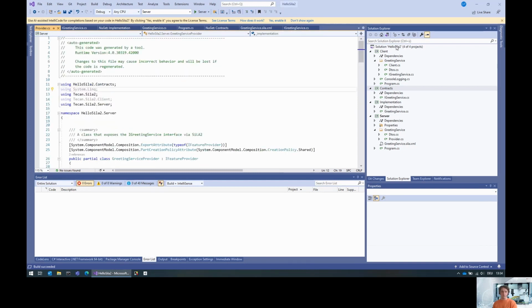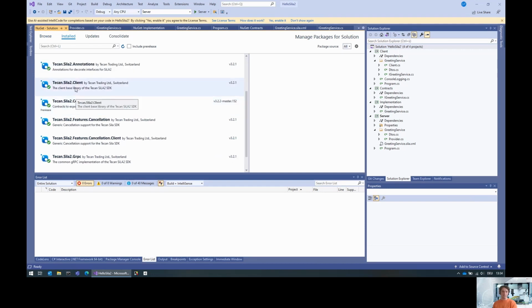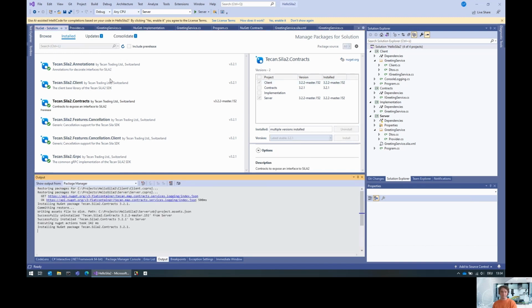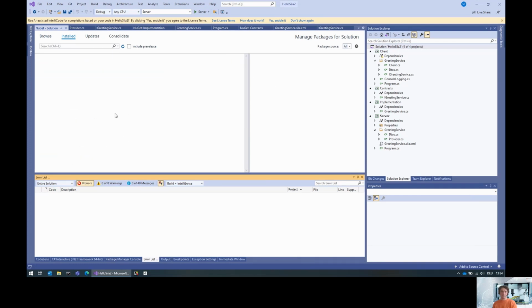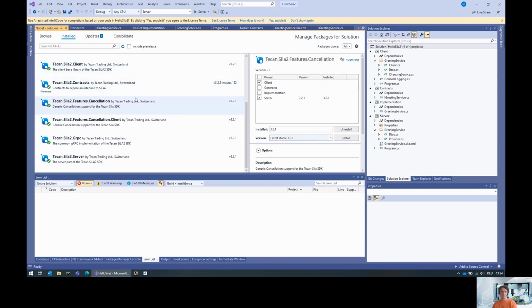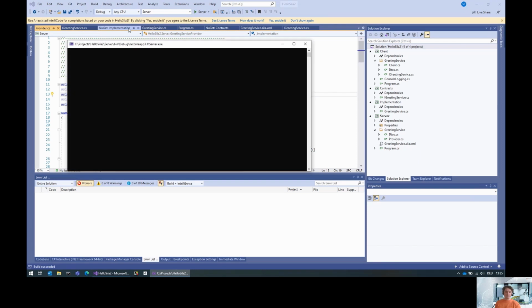Okay, so for those things, the best way forward is to install the same version of everything. This uses a pre-release version for some reason, I did some experiments. Let's make sure that everything uses the same. Yeah, this happens if you want to do too many videos at once. Sorry for that. So let's start the server again.